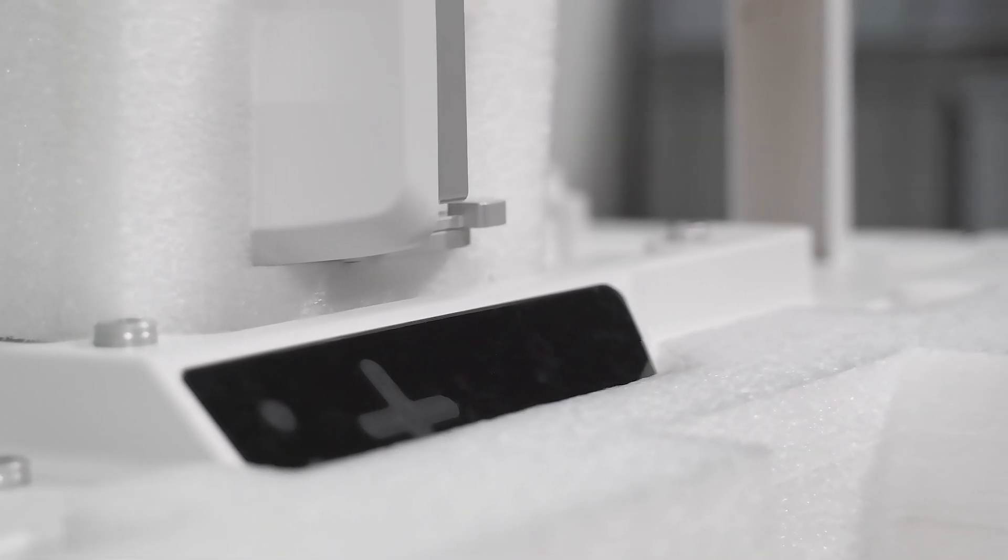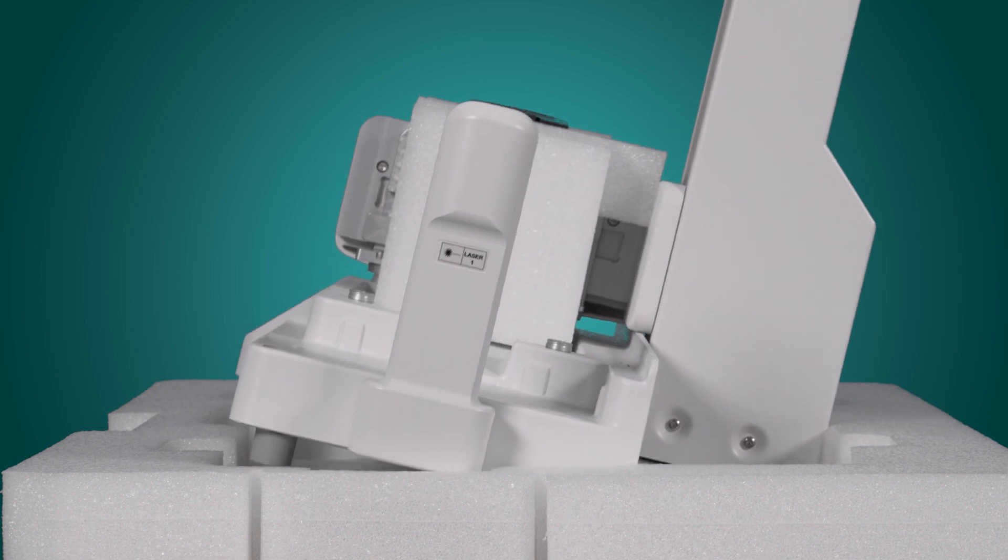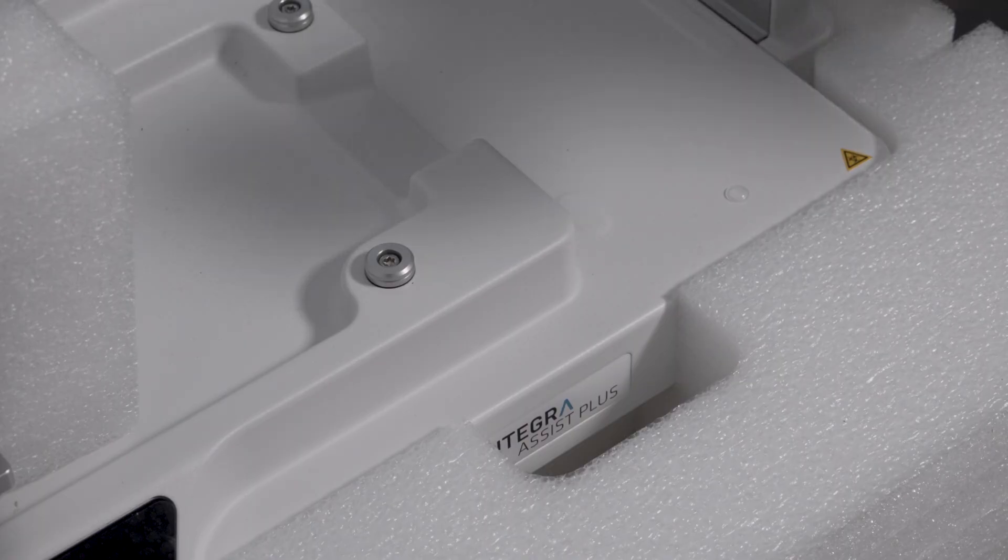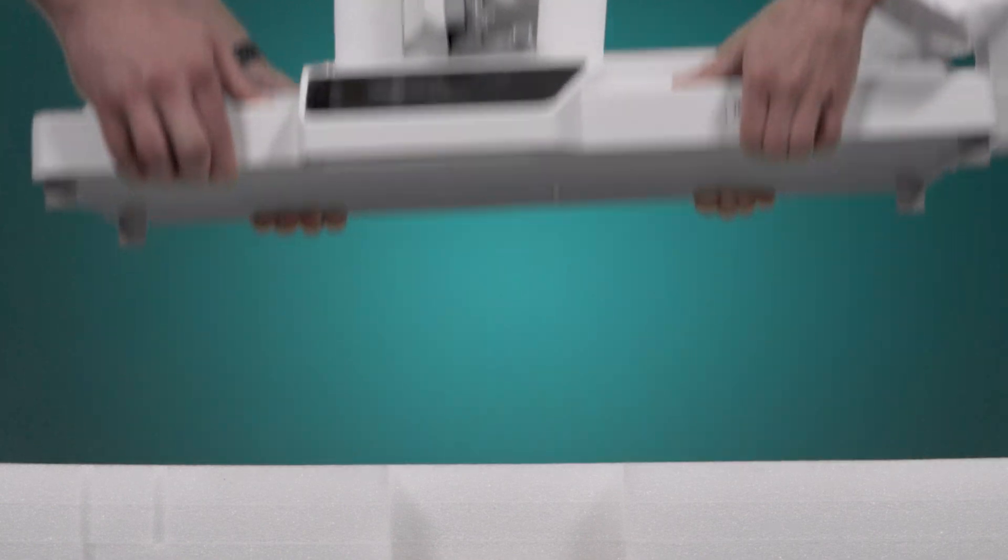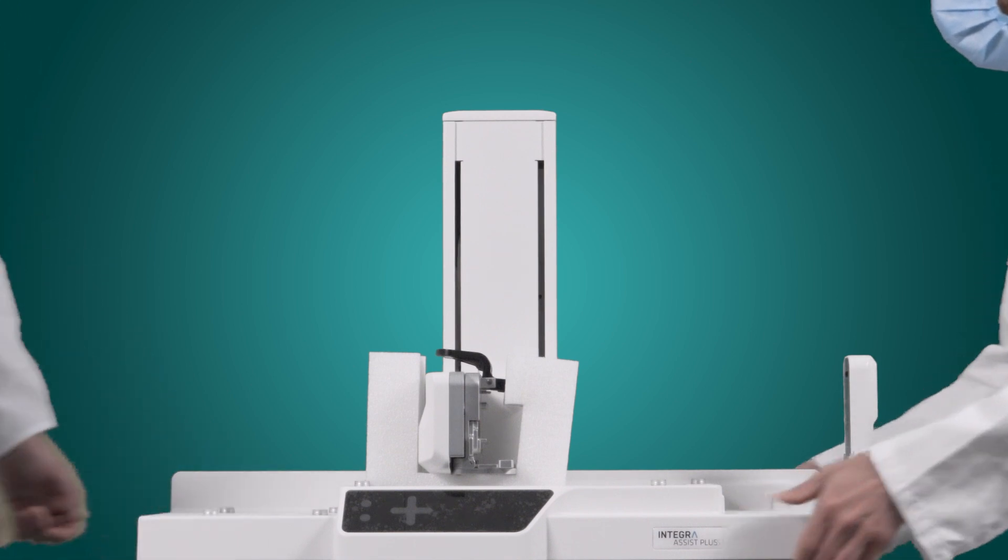Be aware that the instrument weighs about 25 kg. So if alone, grab the top back of the tower and in front below the keypad. Make sure to lift the instrument carefully. If possible, get some help of a second person.